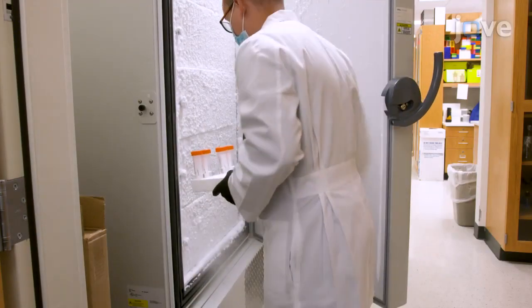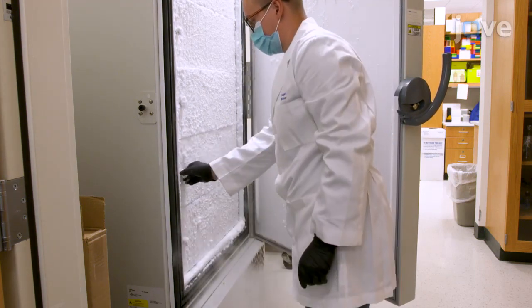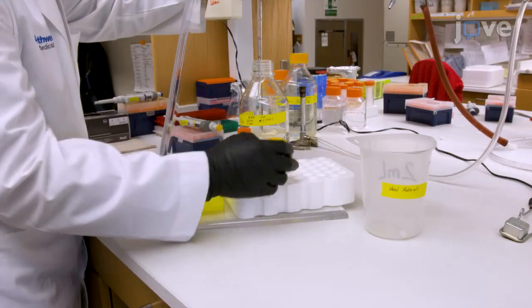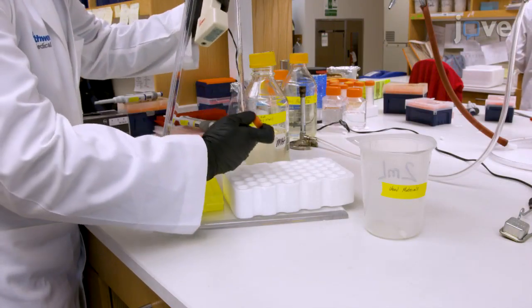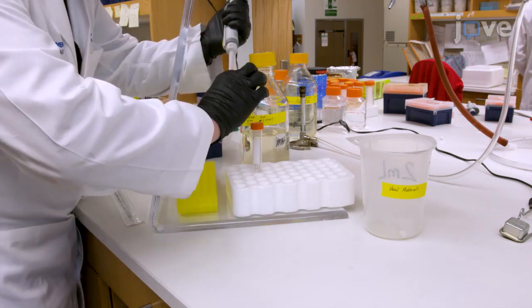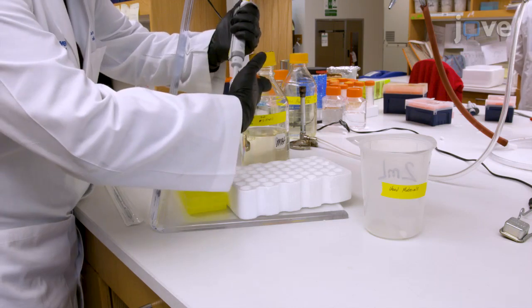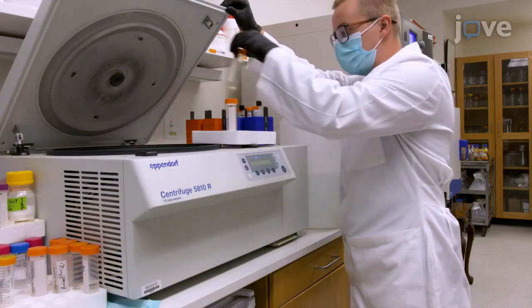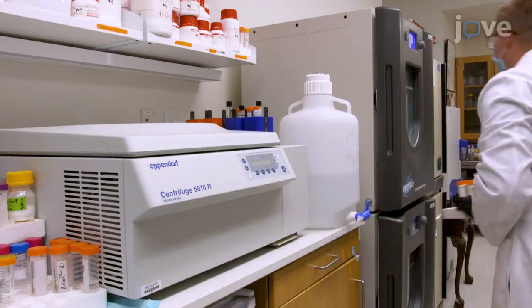Prepare two 20 milliliter aliquots of quenching buffer for each sample and store them at -80 degrees Celsius. Simultaneously, prepare radiolabeling media by adding acetic acid sodium salt to dextrose-free SC media at a final concentration of 10 microcurie per milliliter. Collect the cells by centrifuging at 4,100 times G for 10 minutes.